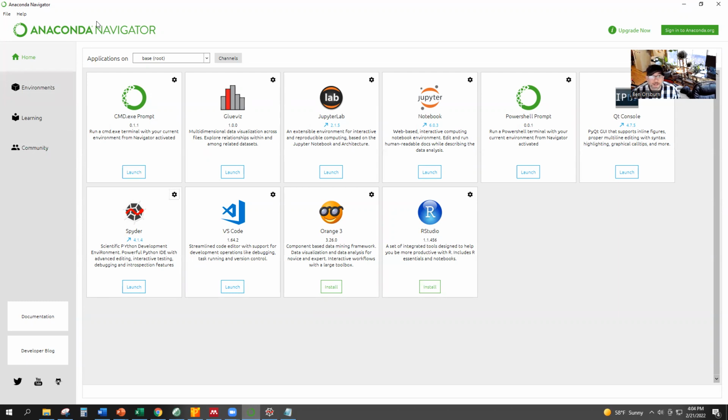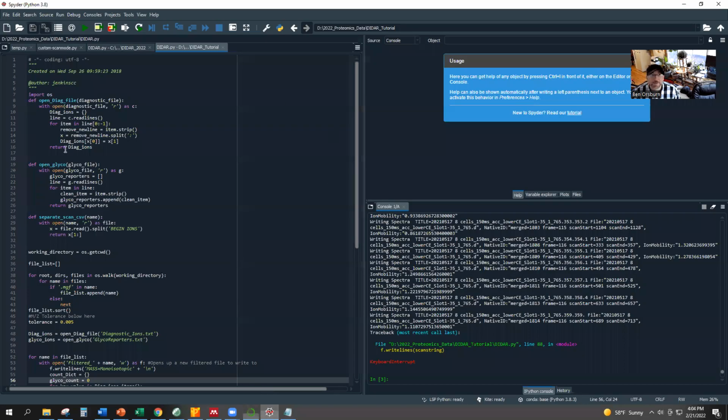And then once you get Anaconda Navigator, Spyder is a scientific IDE. It's already pre-installed. It makes a lot of sense to use it here. And then you would first install it. This orange one here is not installed on this computer, or at least in this instance of this Conda. But Spyder is, and I can launch that, and launching it would bring me into here.